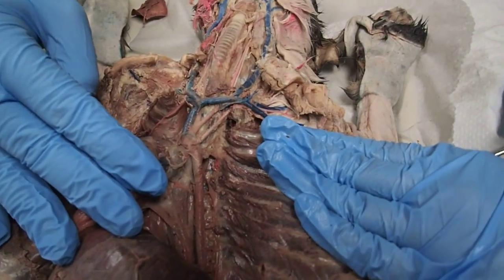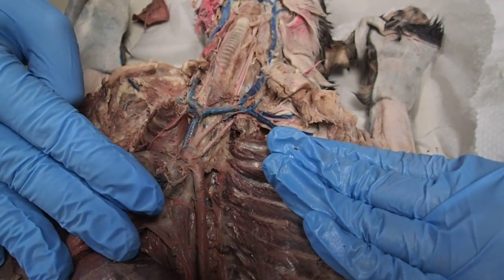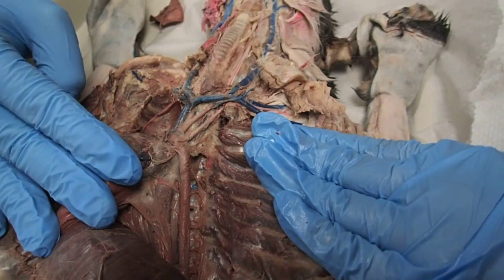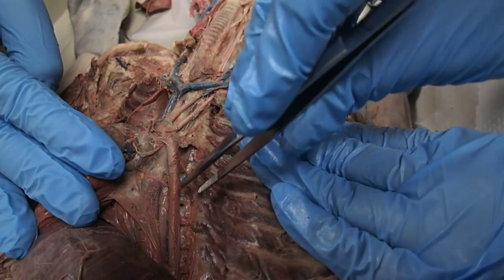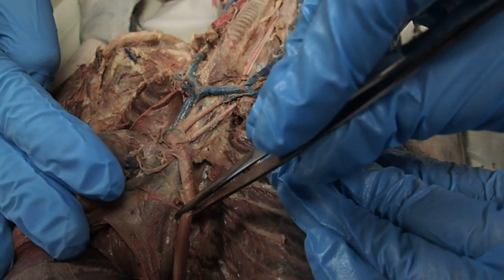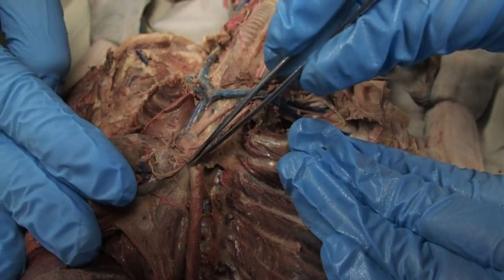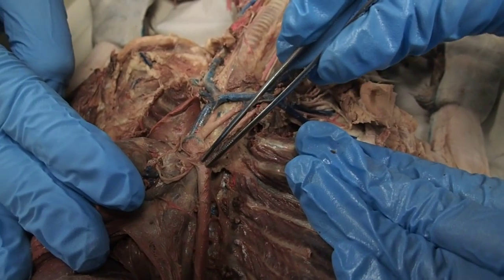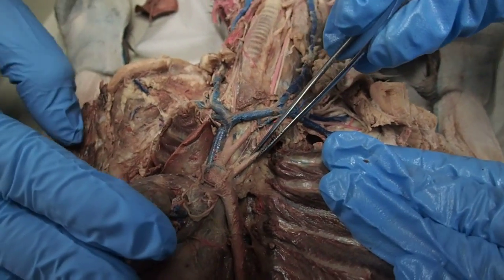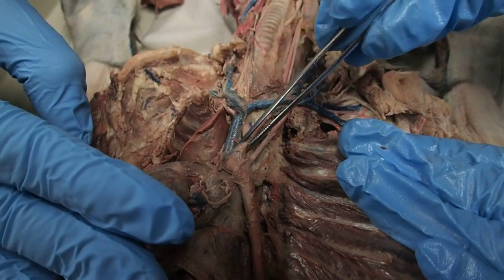We are going over the vessels of the cat in the upper part of the body, starting with the thoracic aorta. If you follow the thoracic aorta up, the first vessel branching off of it is the left subclavian. The next one is the brachiocephalic artery.